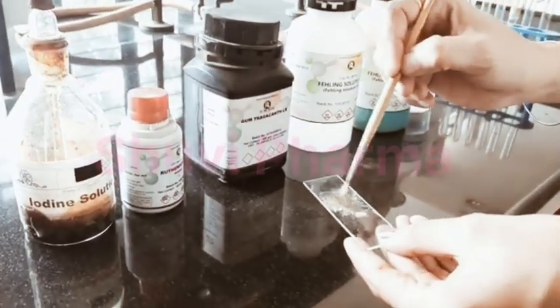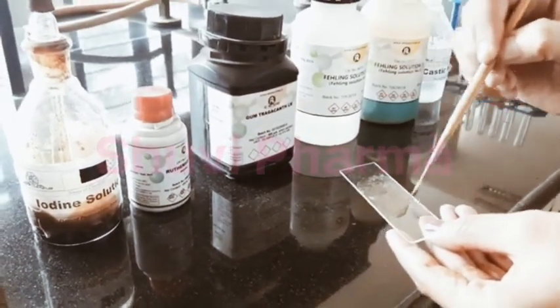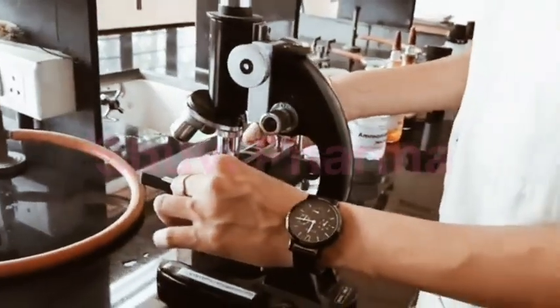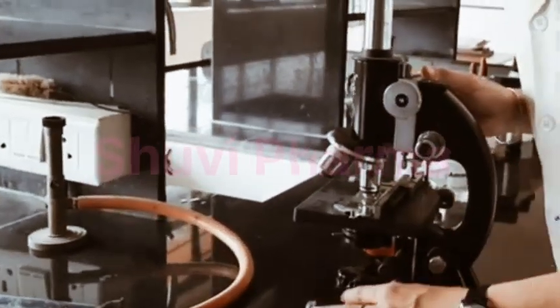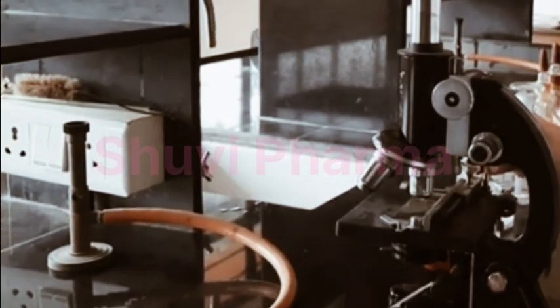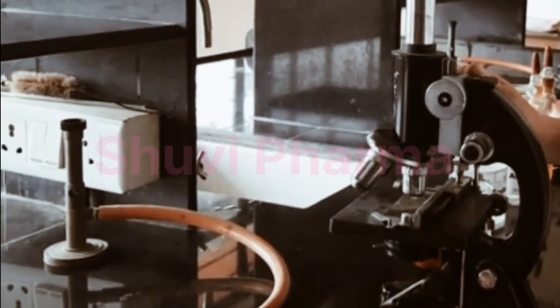Mix this with the help of a brush. And now we will observe this slide under the microscope. Under the microscope, pink color crystals are observed that indicates the presence of tragacanth.